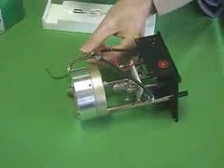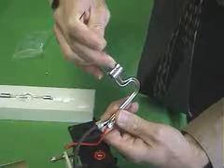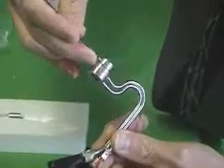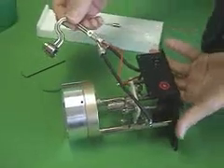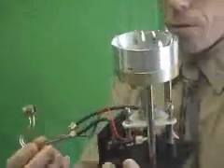Put a second set screw in the end of the anode adapter. Now when you're doing that, pick it up, leave the anode adapter free.